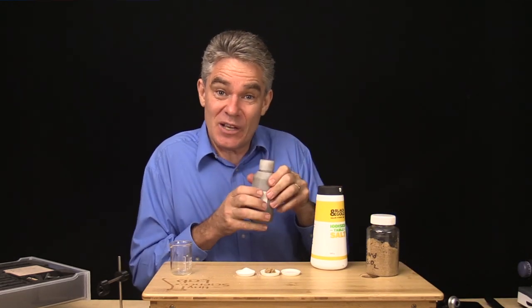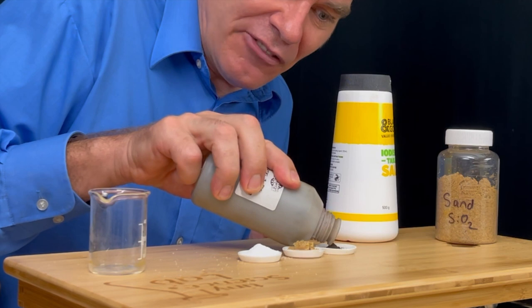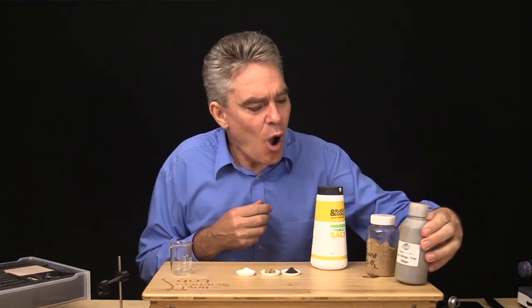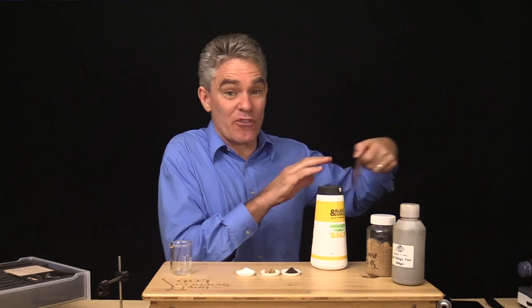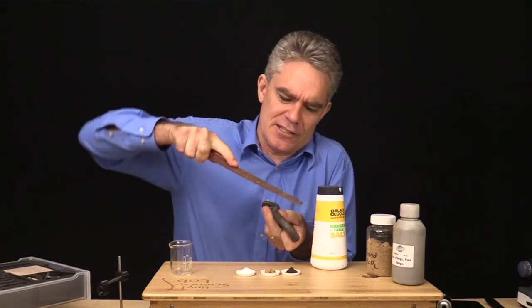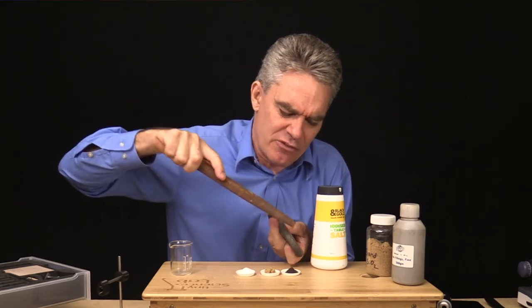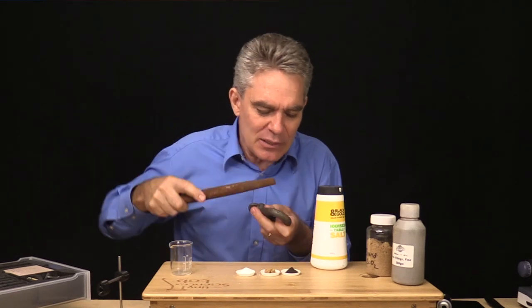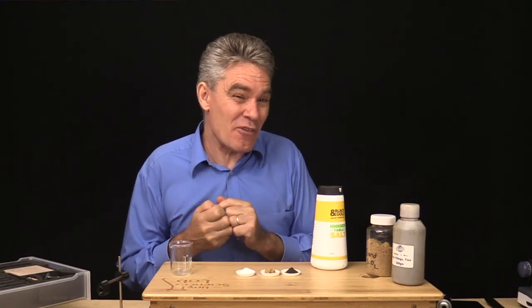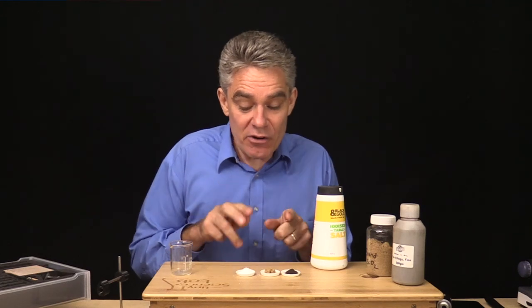Our final substance to add to our mixture is iron filings or iron powder. This is really, really fine and quite dark. Iron is an element — it's made up of one type of atom. I've got a file here and a piece of iron, and to get iron filings you file the iron and little tiny powdered atoms of iron form and go down onto the plate. Iron is an element and a metal, made up of one type of atom, so the iron powder is a pure substance.